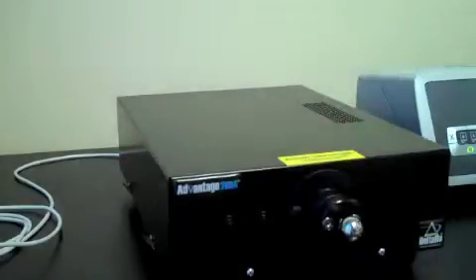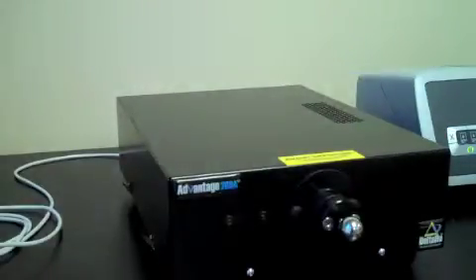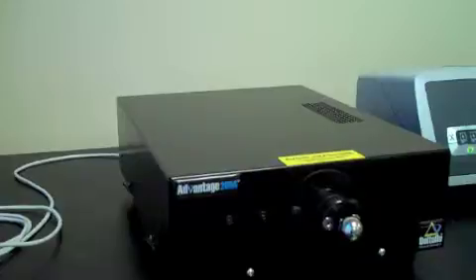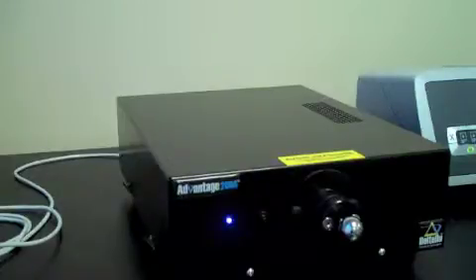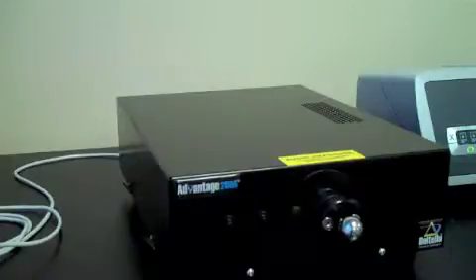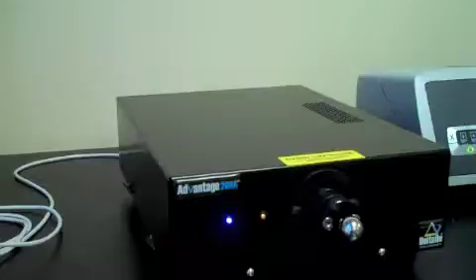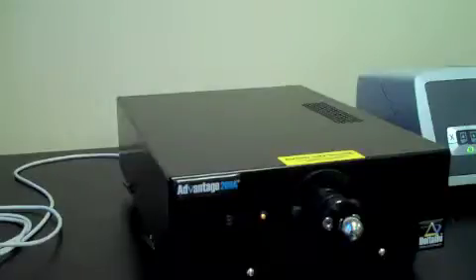Wait a couple of minutes to allow the system to warm up. When the system is ready, the blue LED on the front of the black box should be illuminated continuously, that is not flashing.